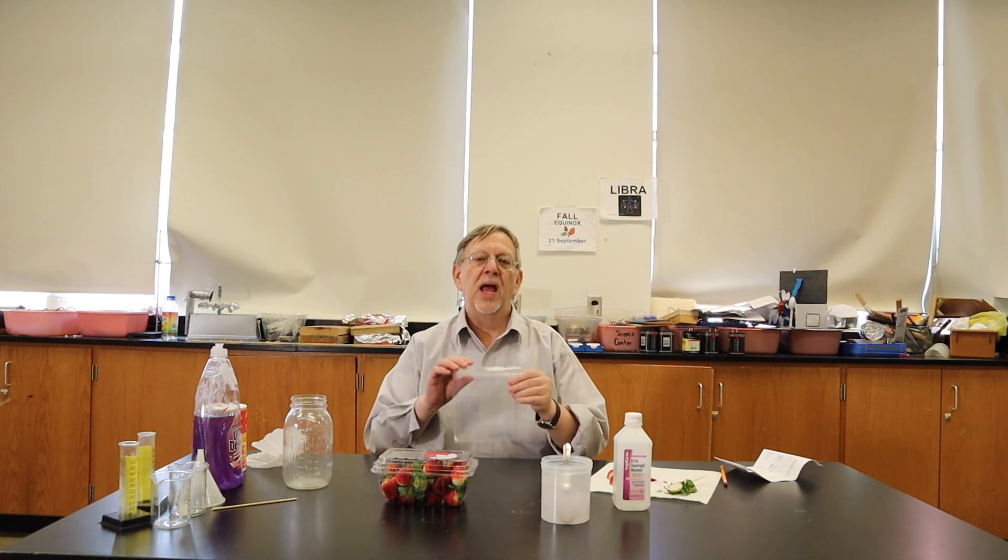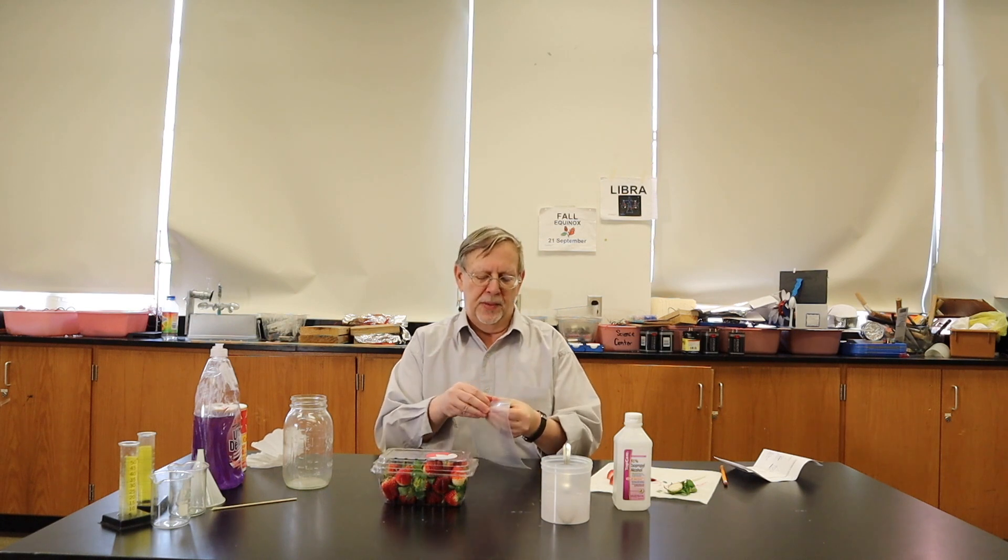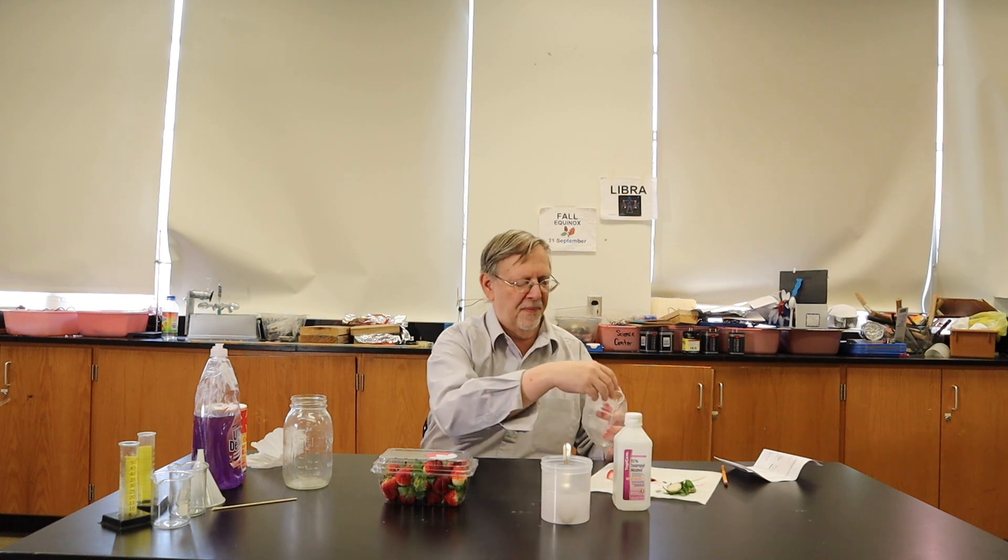Okay, step number two is we need to mush up the strawberries so that we can break apart the cells. So I've taken two strawberries and I'm going to put them in a plastic bag and I am going to smush them up as best as I can.